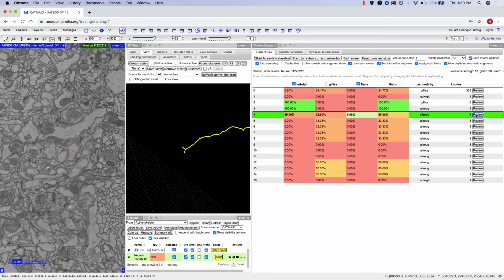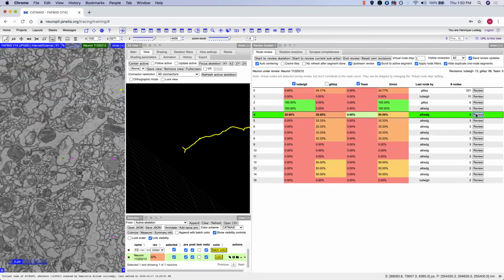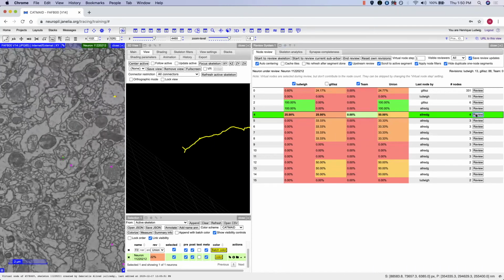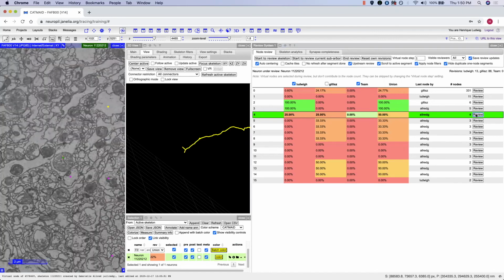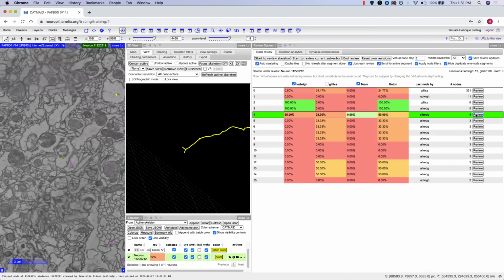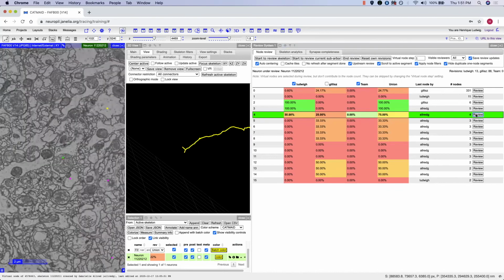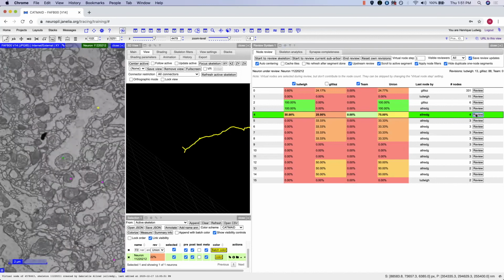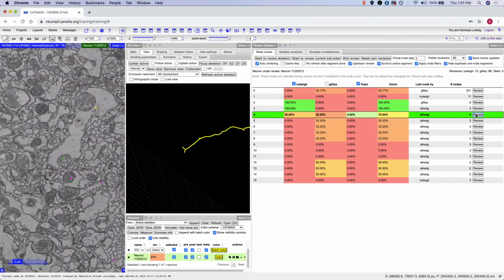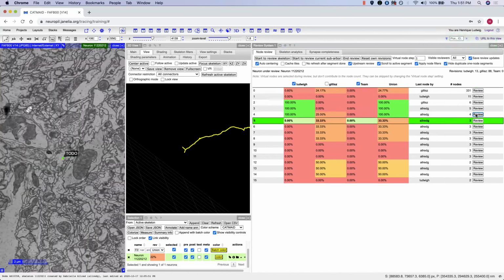Pressing W will move you forward in the review process, like so. Pressing Q will take you to the previous node that you've just reviewed. Once you've made it to the end of the review for that segment, you can press E. This will take you on to the next segment of the review.